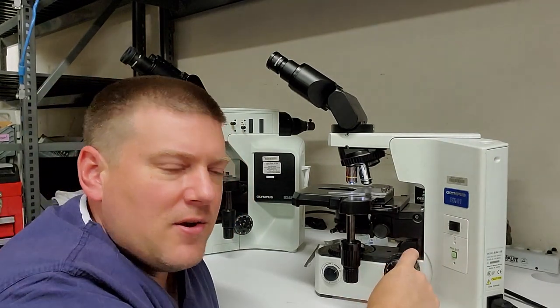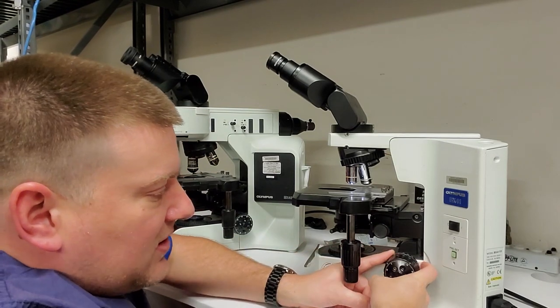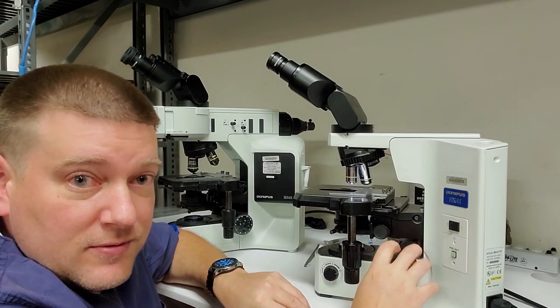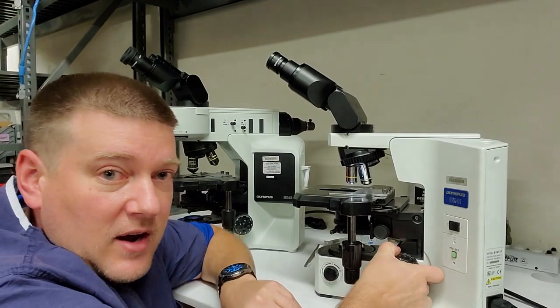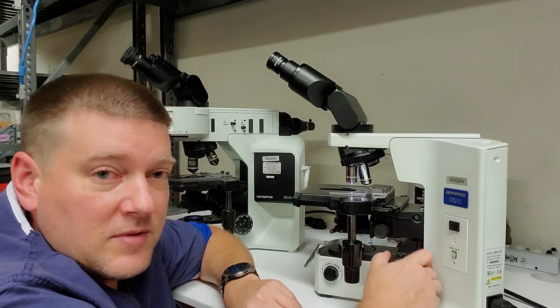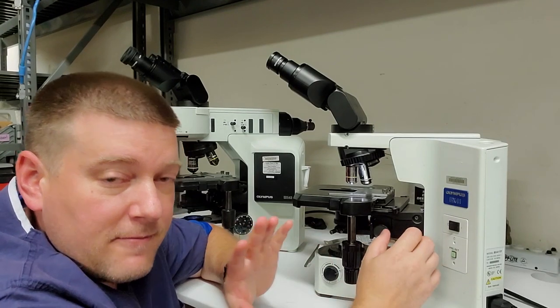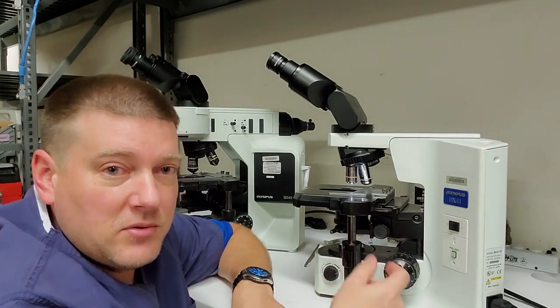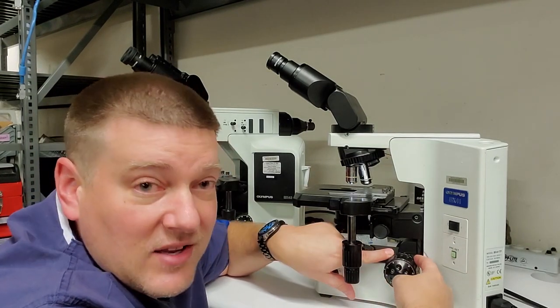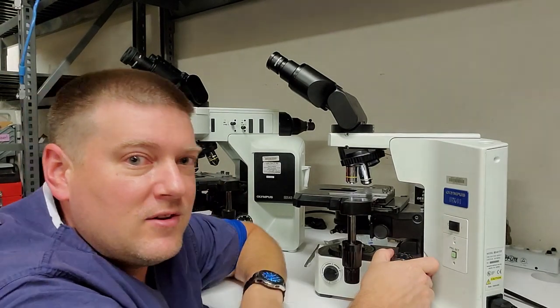And then behind the knob, right back here, is something called a tensioning ring. All right? So you adjust the tension ring, and what that does is it adjusts how difficult it is for this knob here to spin. Now some doctors, especially females, like this to be more loose. And some doctors, males, I don't know, they just tend to like it more stiff. So when they say that it's all bound up and you can't really move it very much, just go in and adjust your tensioning ring and show the users how to adjust their tensioning ring, and you're going to solve some problems.